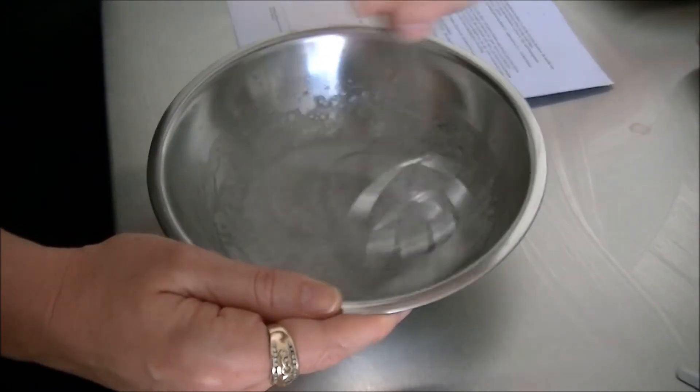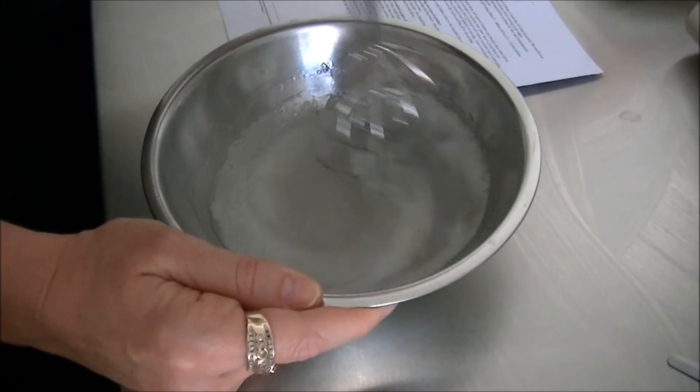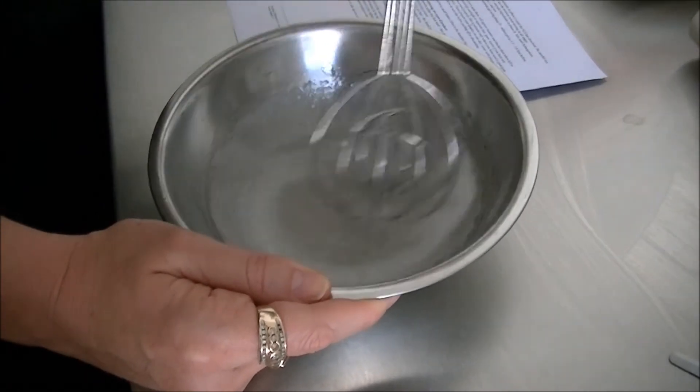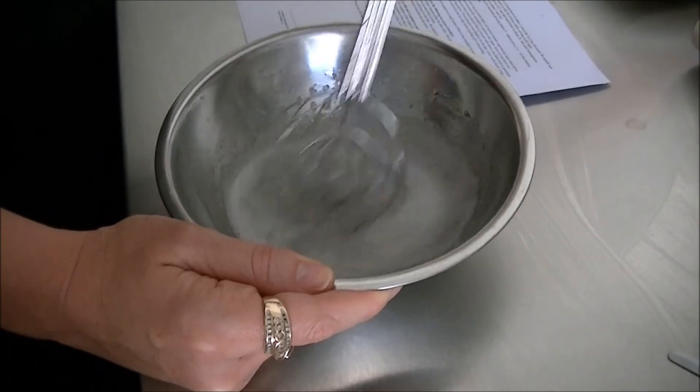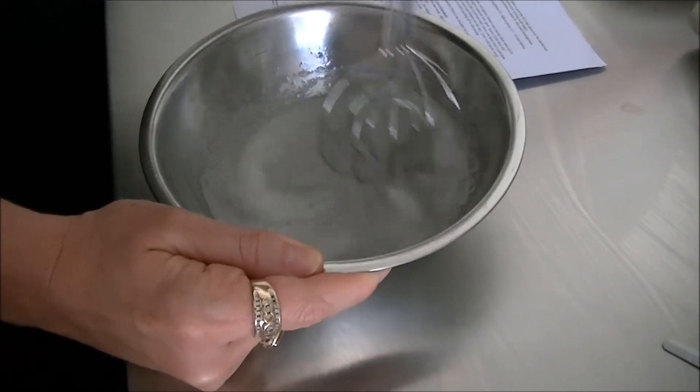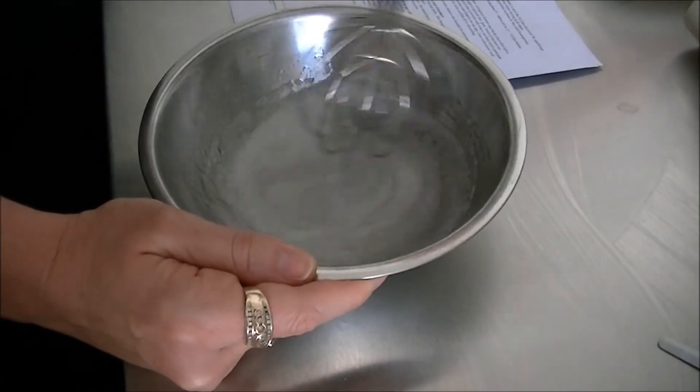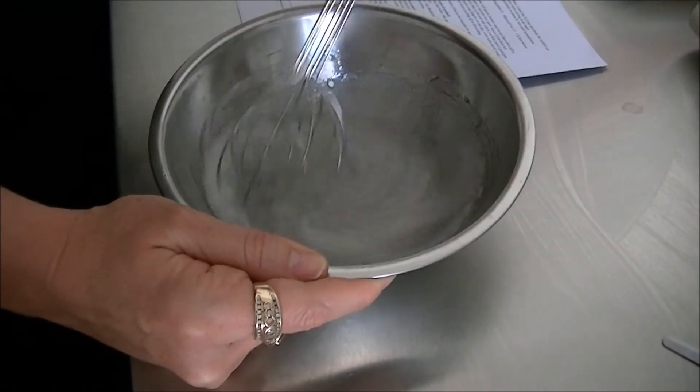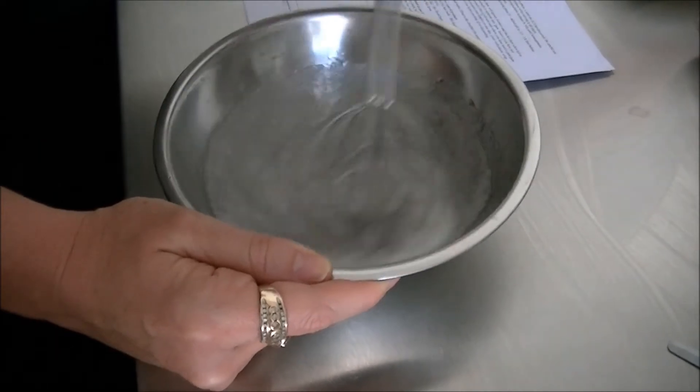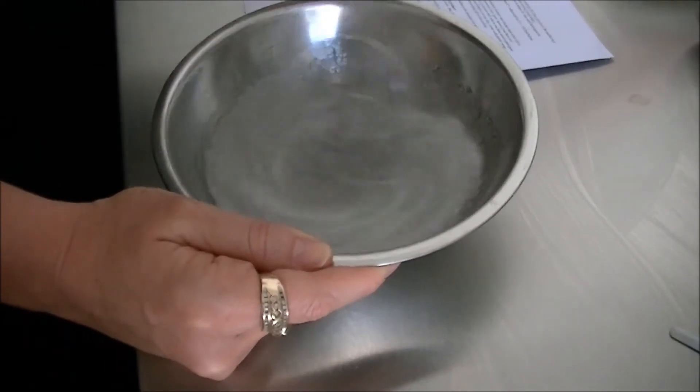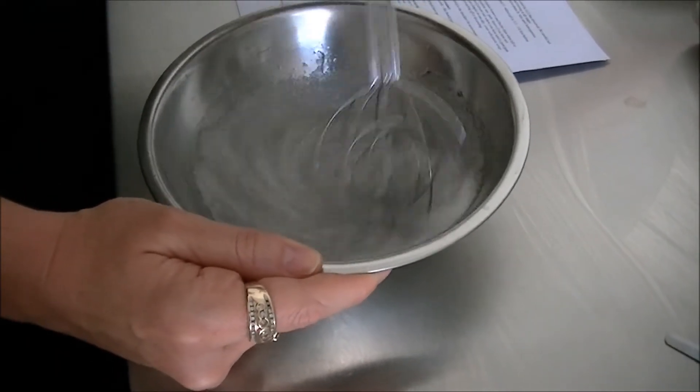You can see I'm starting to get a bit of a gel form. I've also got quite a few bubbles in there. But that again can't be helped when you're creating a surfactant sample in the lab.